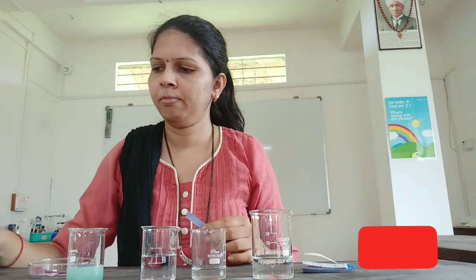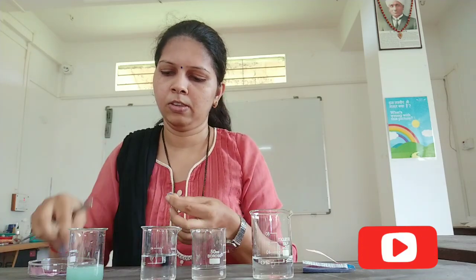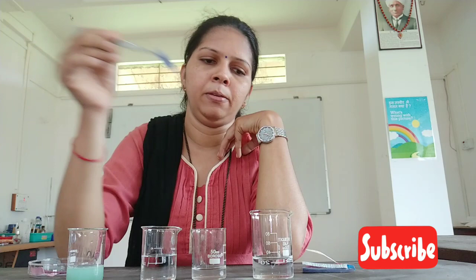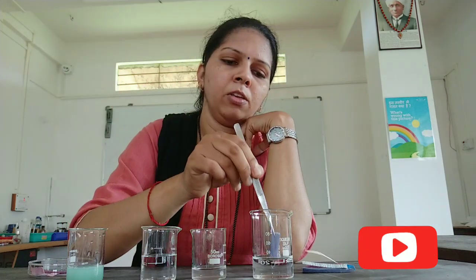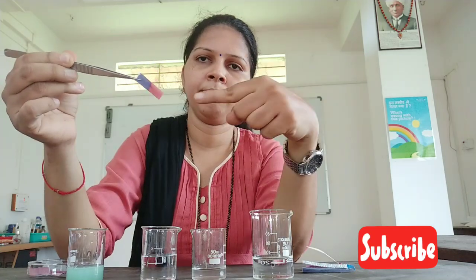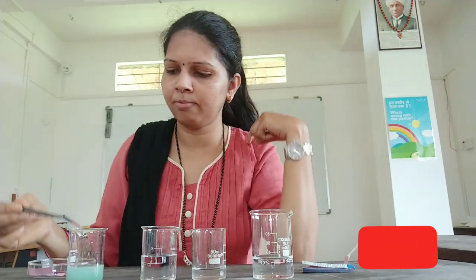Let's find out. Here I have four beakers containing four different types of solutions. Let us find out whether they are acidic or basic. Let me take a blue litmus paper and dip it in the first beaker. Observe the color change — you will notice the blue color turned red. So what do you conclude? The substance in beaker A must be acidic.